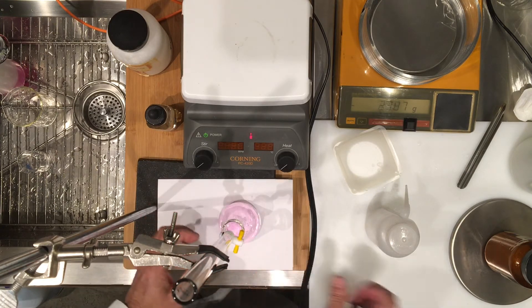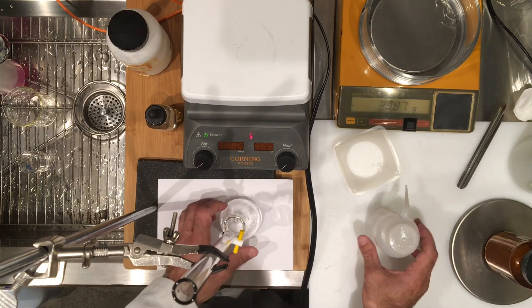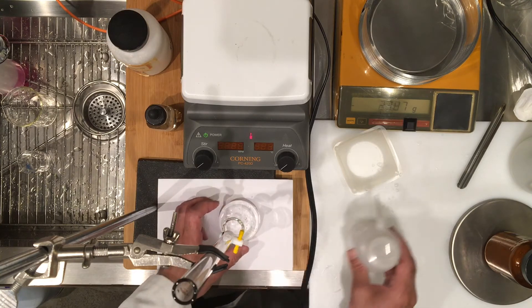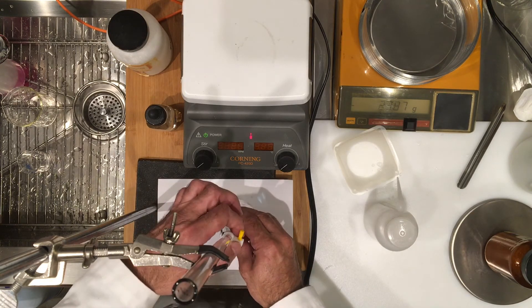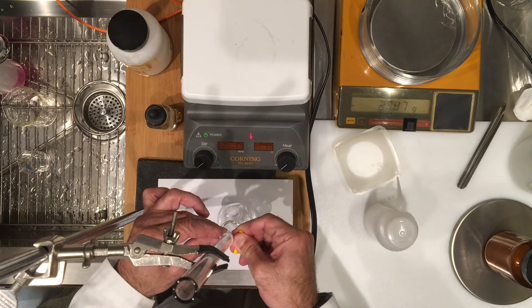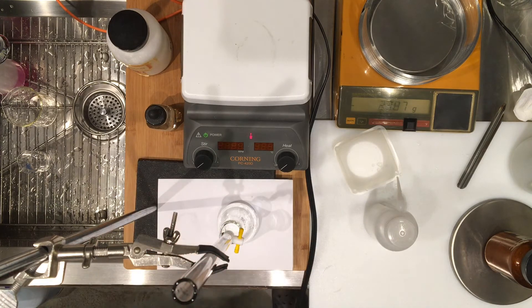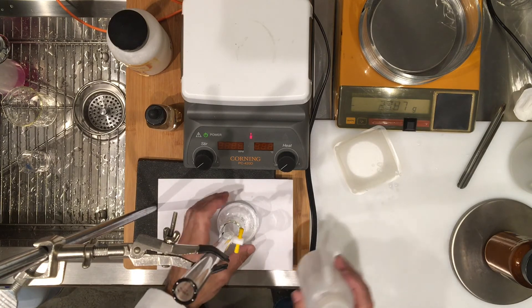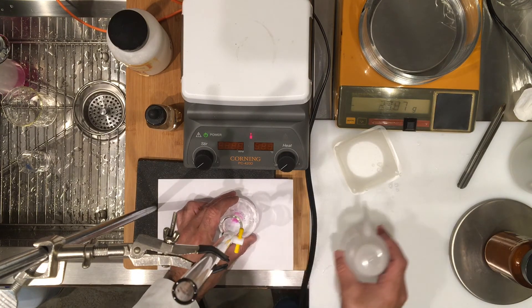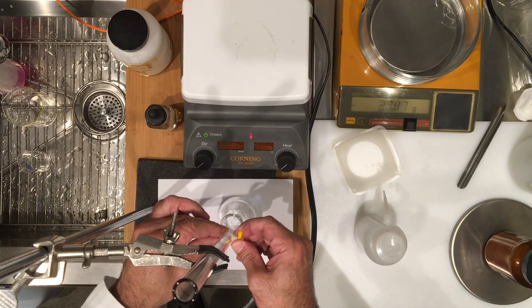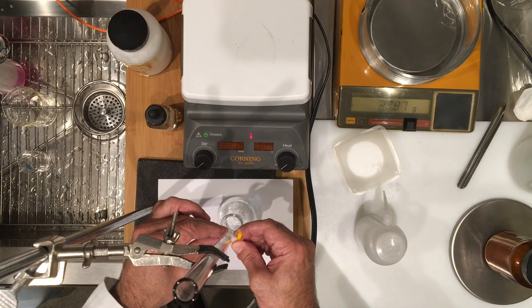I should be very close now. In fact, well not yet. I'm going to wash the sides of the flask, make sure there's no hanging drops of sodium hydroxide or KHP there. I'm going to add maybe half a drop. To do a half a drop, I pour in an equivalent of half a drop hanging, and I'm going to use my wash bottle to get it in. It didn't do it, so maybe I'm not as close as I thought, but certainly within a couple drops maybe.